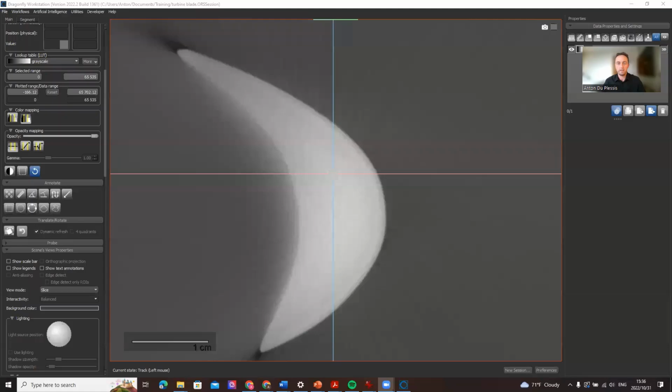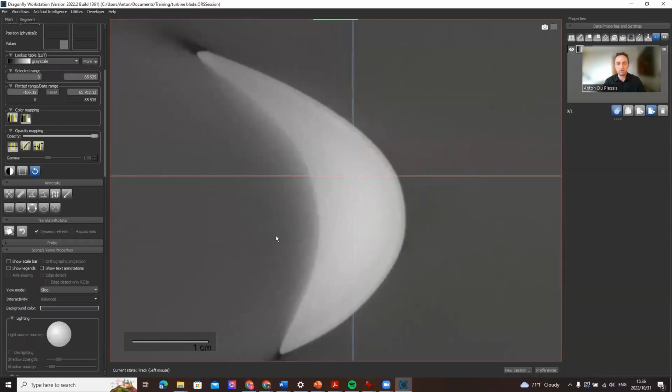In this video I'm going to show you a new shading compensation filter called the manual 3D RBF filter. The RBF stands for radial basis function, but you don't need to know that. All you need to know is this is a really great way to compensate for grayscale variations across your image.